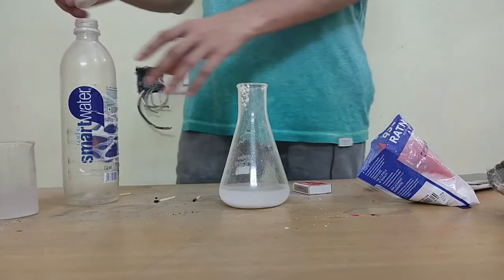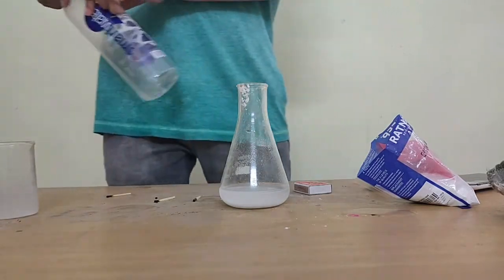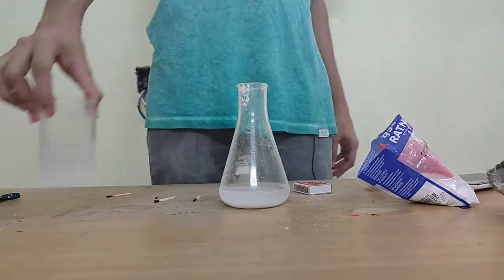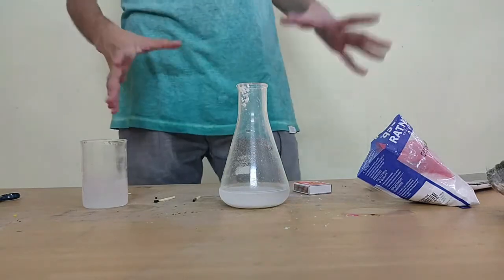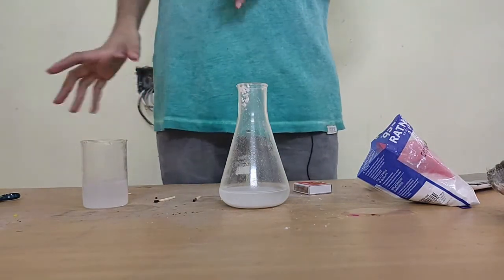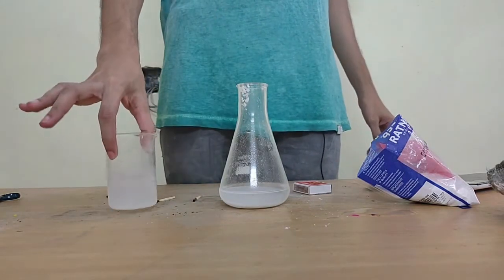Now the flame test is something that we try. Like I said, it's not indicative, meaning it's not always for sure that it's carbon dioxide. So that is why the lime water is the definitive test, okay? This is definitely true. So in your experiment, we will not write the flame test, okay? When you're taking notes, make sure you don't write about the flame test, write only about the lime water going milky, alright?